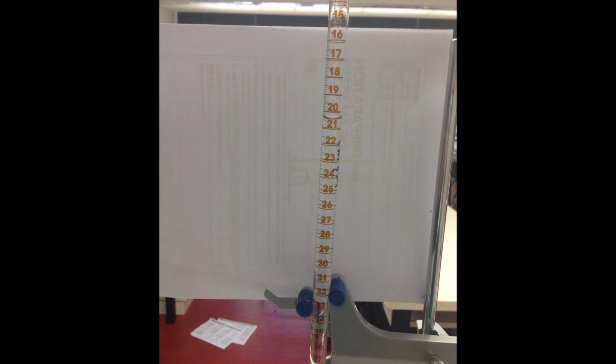Step 8. Record all information for later calculations. Repeat the titration another 3 times until a consistent volume of titrant is obtained. Often the first titration will overshoot the equivalence point, as an unknown approximation volume will occur. This will allow for estimation in volume for the other titrations.